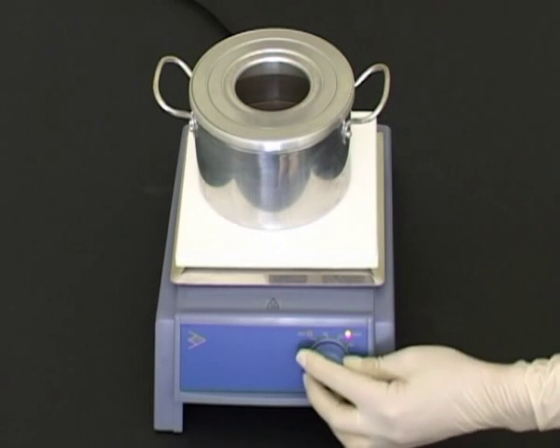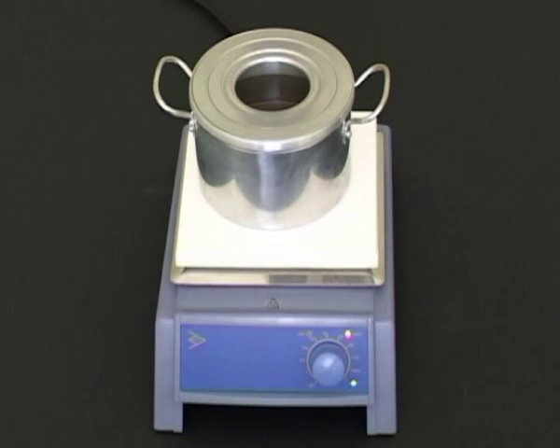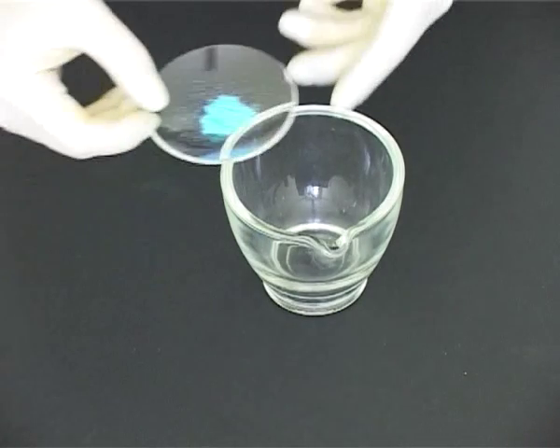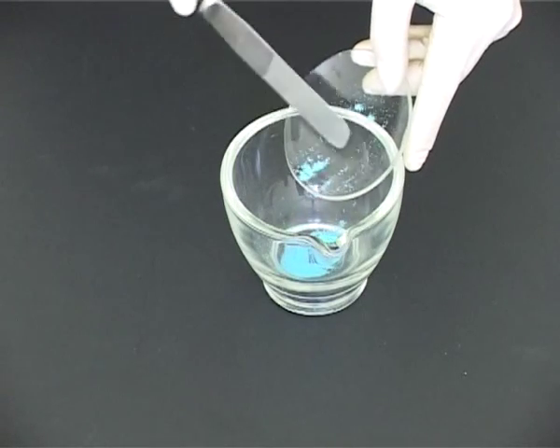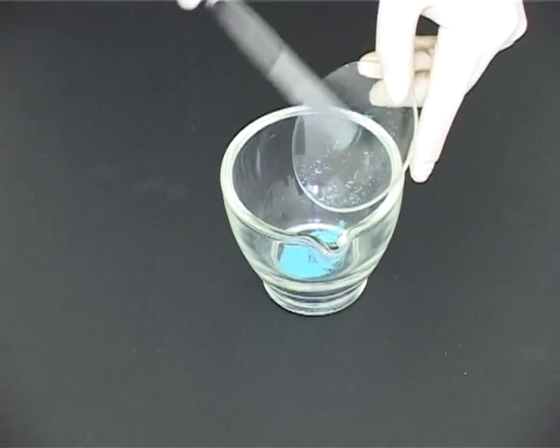Turn on the heater to heat up the water bath making sure there is enough water in the water bath. Whilst the water reaches temperature, transfer the previously weighed powder to be incorporated into the suppositories into the glass mortar.